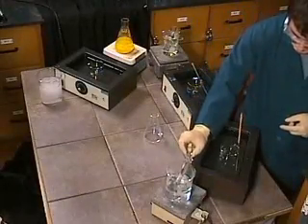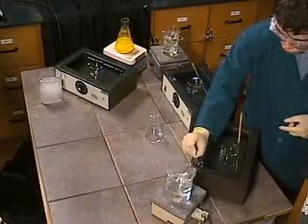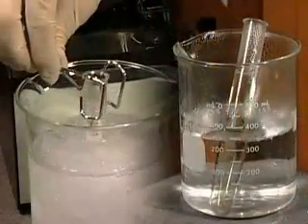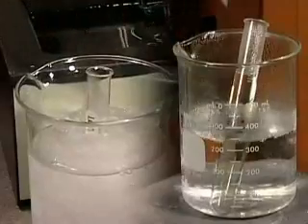Solubility is the amount of solute in solution at a given temperature. In this demonstration, the relationship between solubility and temperature is explored.